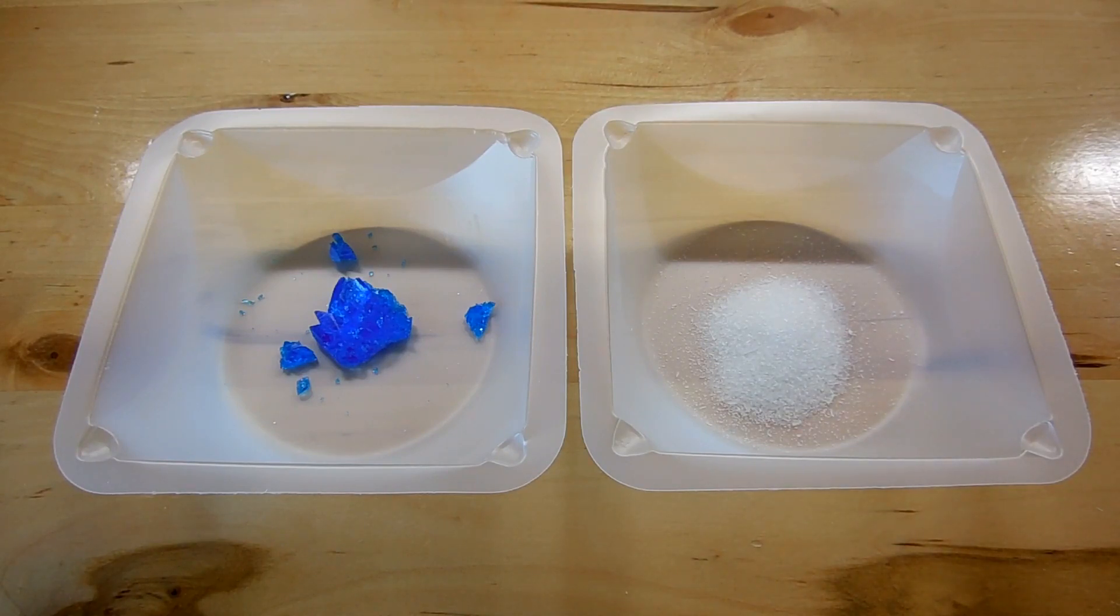Now, this is actually very simple to make and it illustrates how cool copper chemistry can be. So all we need here is copper sulfate, which is on the left, a little crop of crystals that I have that's 2.4 grams, and the other ingredient is sodium metabisulfite, which is on the right, and that's 2 grams of that.